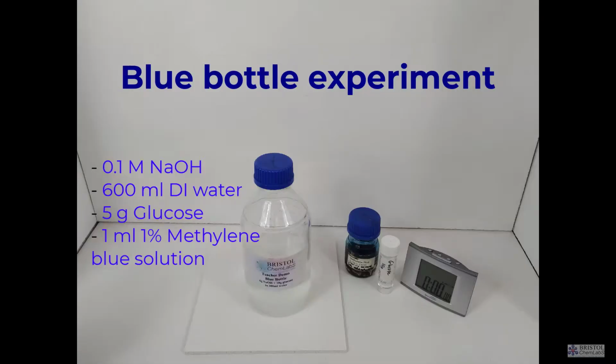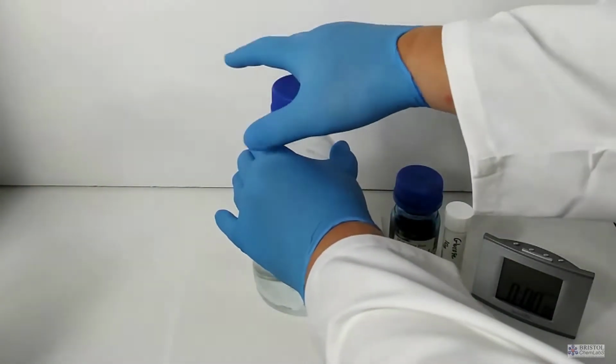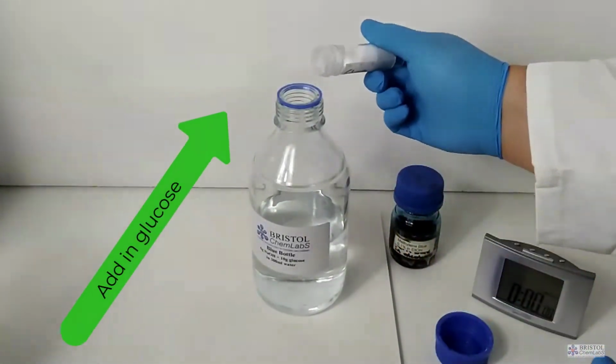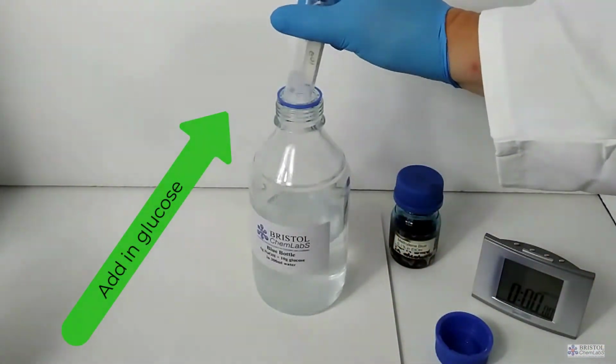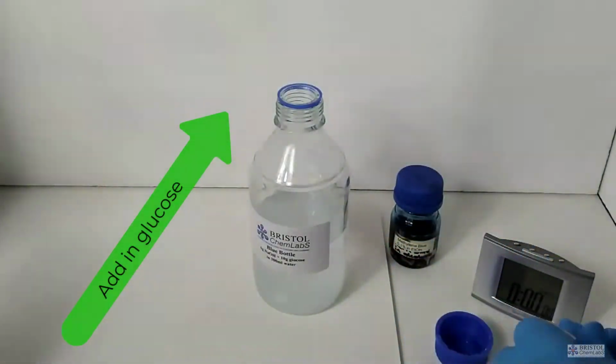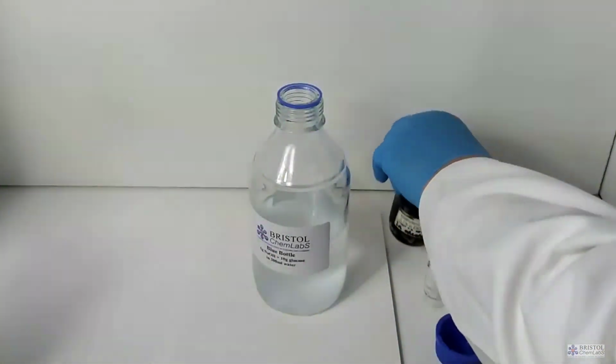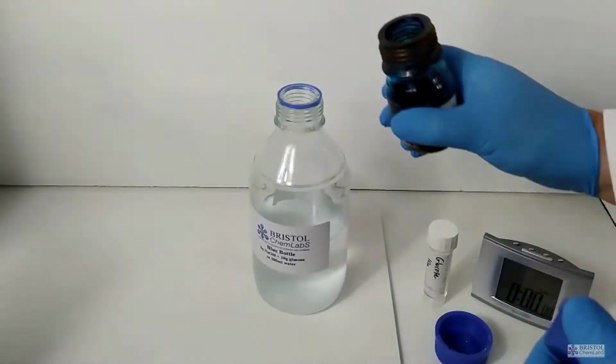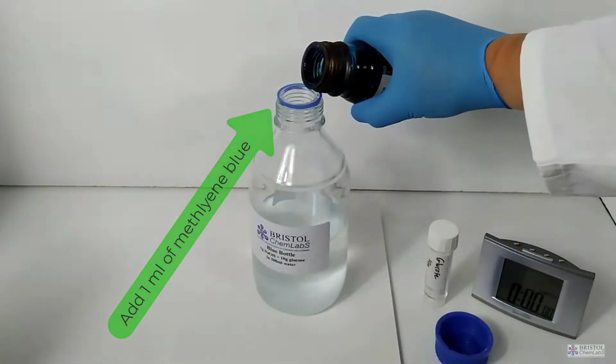Methylene blue solution that we're using here is a 1% solution in alcohol, and to aid the demonstration we've pre-weighed 5 grams of glucose. The experiment mixture is a straightforward one. Into the sodium hydroxide solution we add the methylene blue and the glucose. We don't need to be particularly careful with the measuring of the methylene blue solution. Approximately 1 cubic centimeter is sufficient.